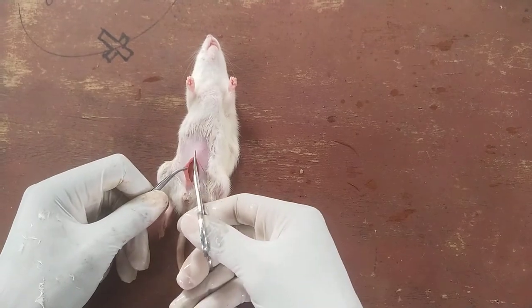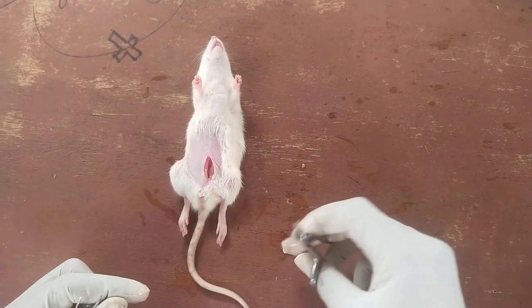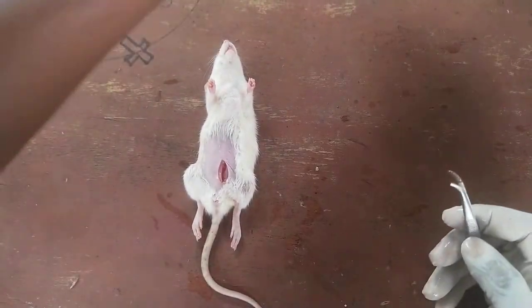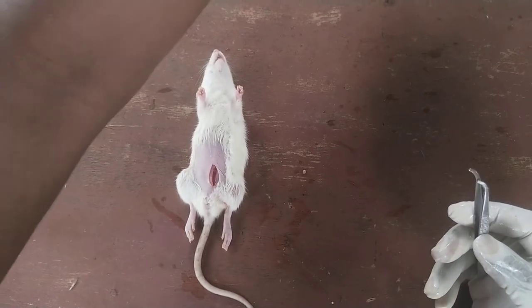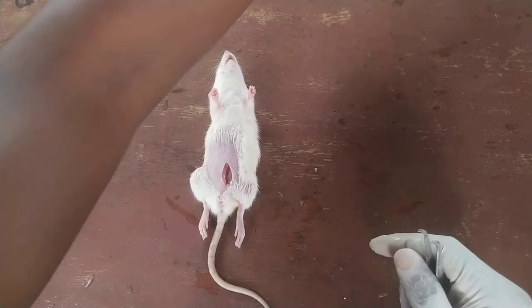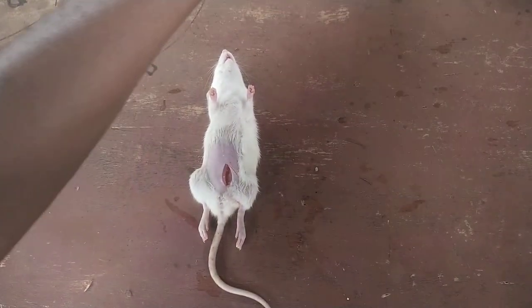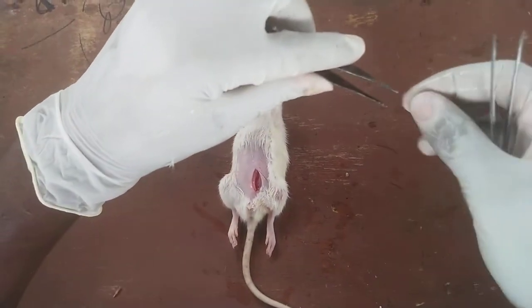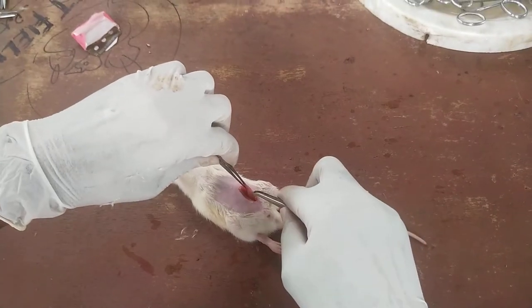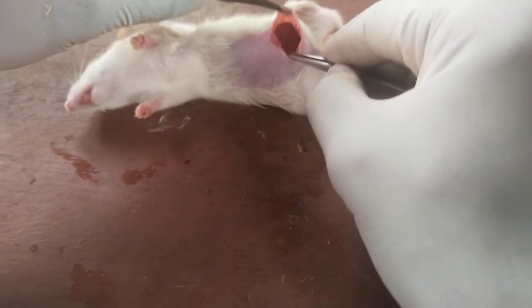This is our incision as we've made it. The next thing to do is locate the ovaries — it's not really an easy thing, but if you have been able to study and know the anatomical position of the ovaries it will actually make it easier to locate them. Turn the animal and lift it to look for the ovaries.